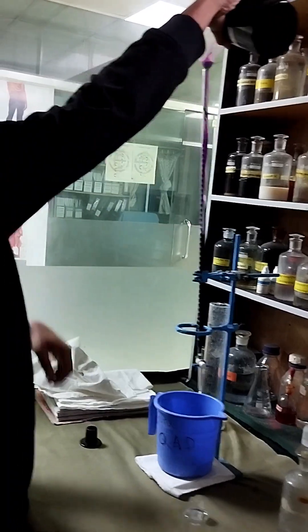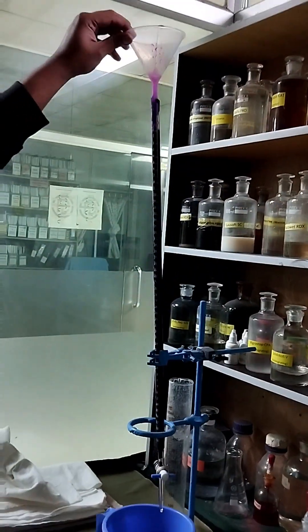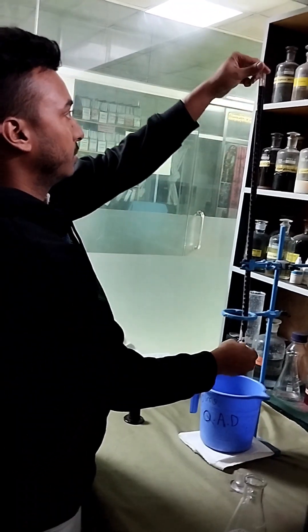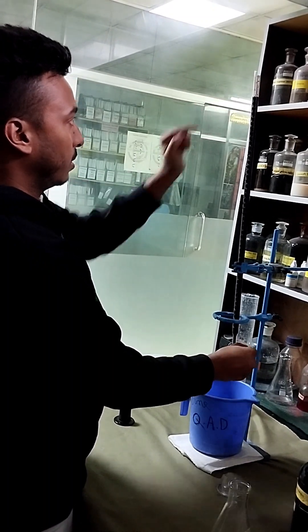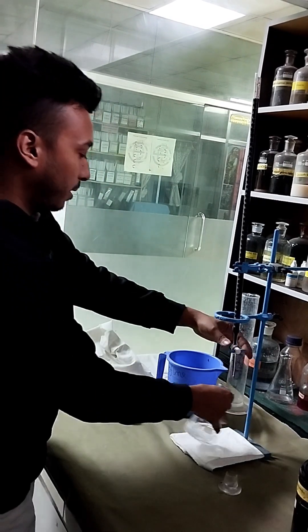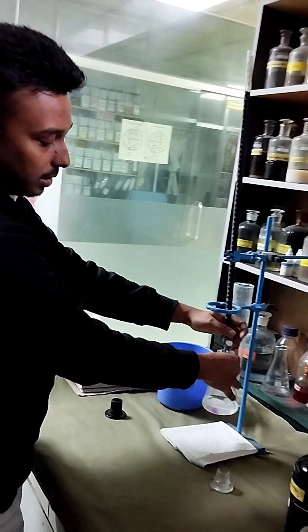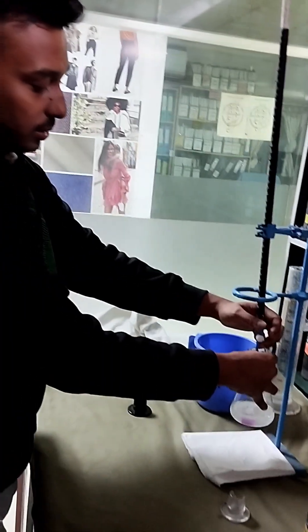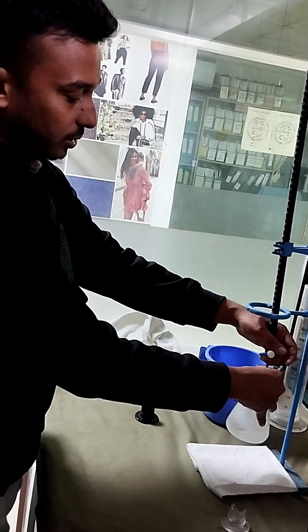We will take the potassium permanganate into the 50 ml burette so that we can titrate it. We will fill the burette and count from zero. Now we start the titration — we will titrate until the solution turns purple or reddish, the color of potassium permanganate.